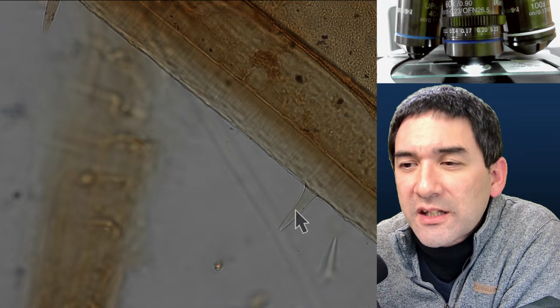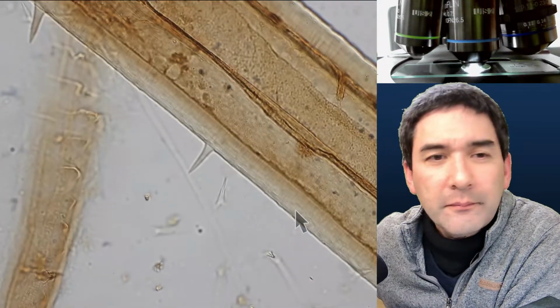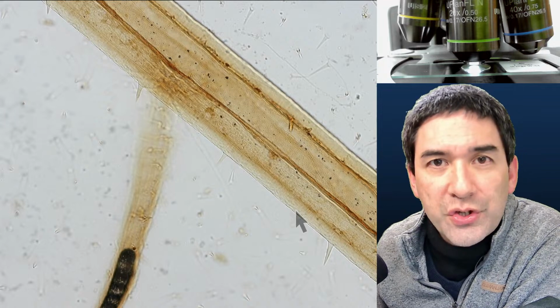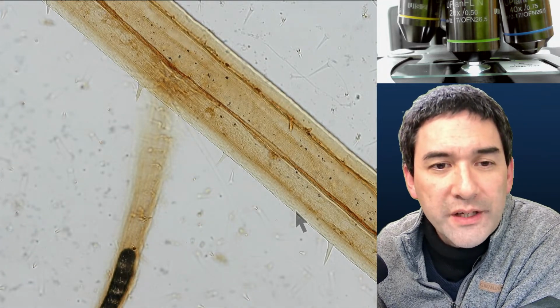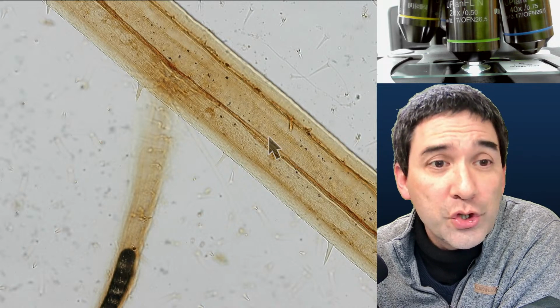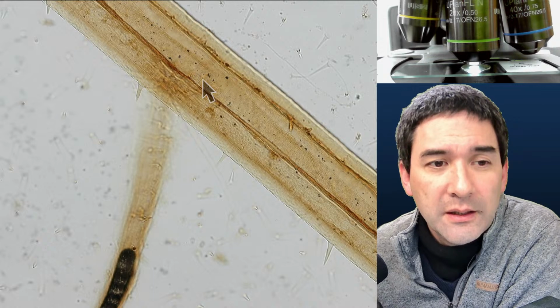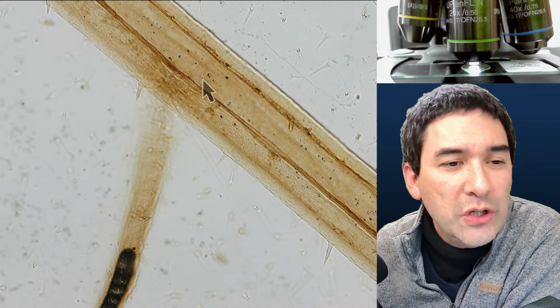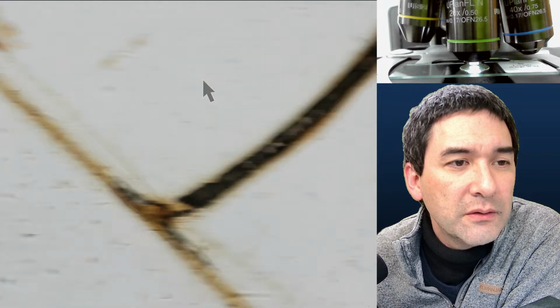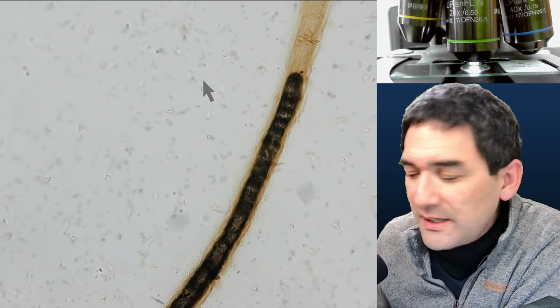So what are those vessels for? Well, the vessels, let's go down a little bit. Insects, of course, also have a circulatory system which transports nutrients and oxygen, right? Because if they're living cells, then they need to be supplied as well. Do you see this very dark thing here? This is usually an indicator that there is air enclosed.